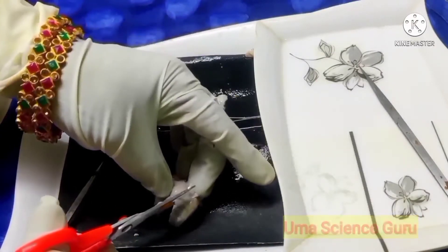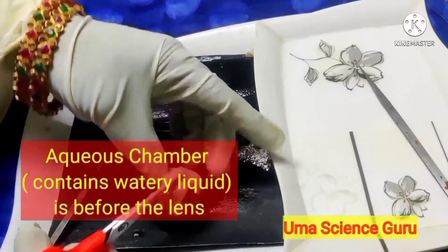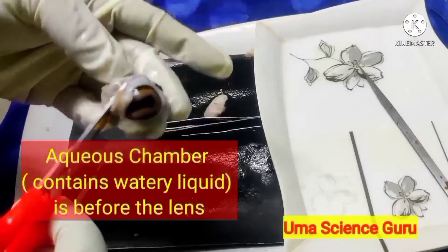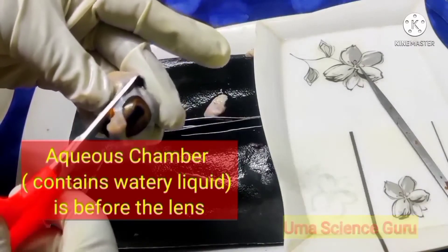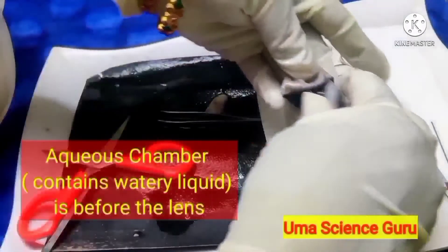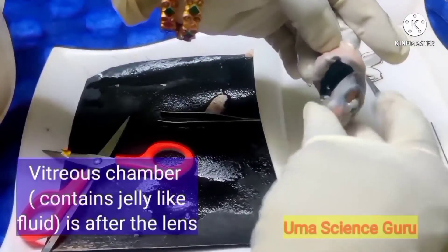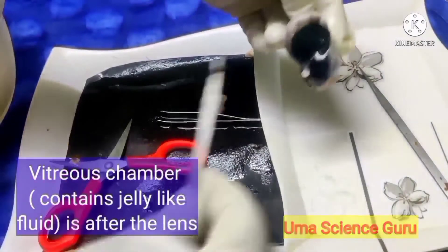Students, do you know the crystalline lens is present in our eyeball? This lens divides the inner space of the eyeball into the aqueous chamber and vitreous chamber. The aqueous chamber is filled with a water-like fluid, whereas the vitreous chamber is filled with a jelly-like fluid. Observe the jelly-like fluid present in the vitreous chamber. Observe the crystalline lens — the transparent lens in the vitreous chamber.